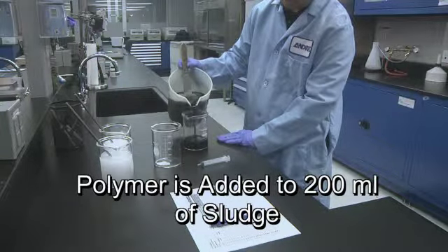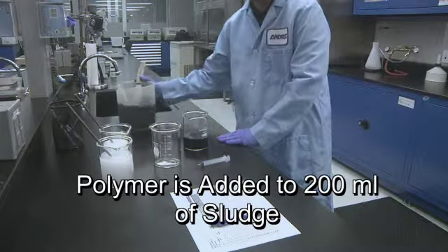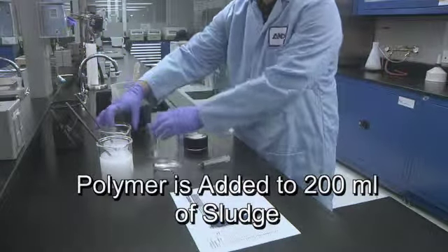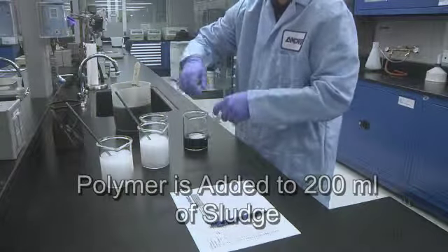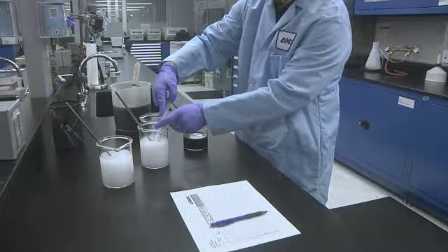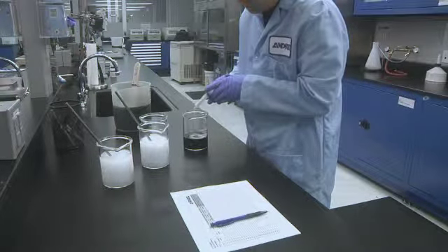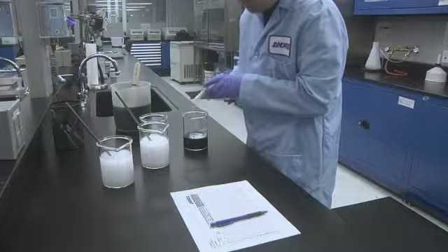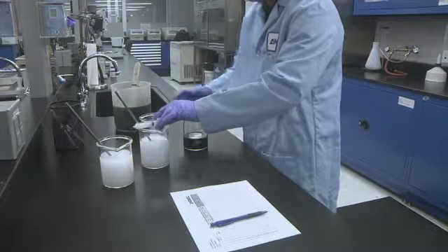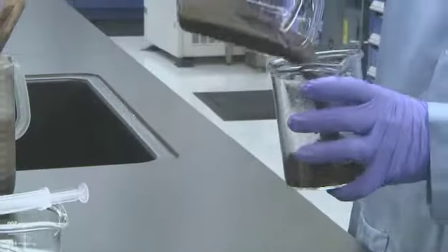Polymer is incrementally added to 200 milliliters of sludge and thoroughly mixed. Sludge can be conditioned with various dosages of polymer using an overhead stirrer or beaker-to-beaker mixing called the boxing method.